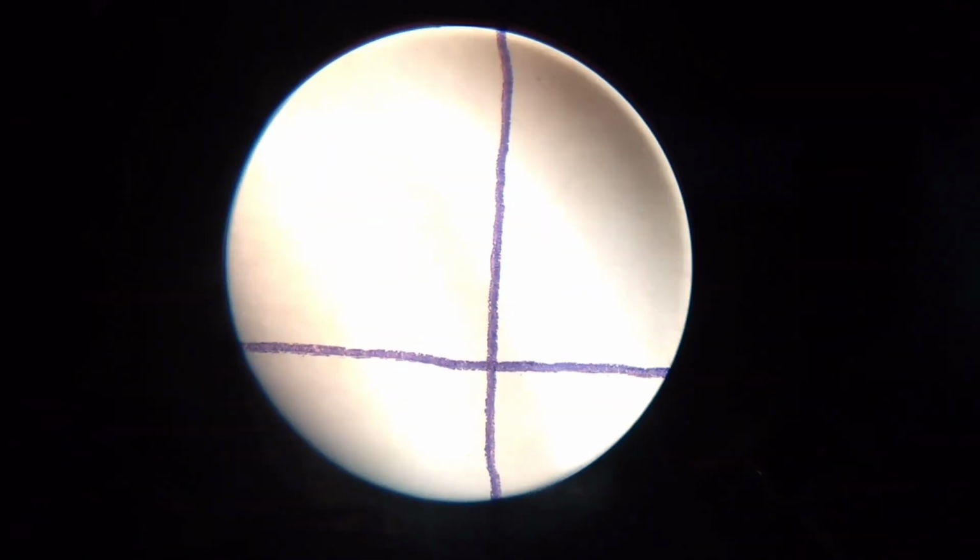Well, as you saw, disassembling and assembling this microscope is quite simple. And then I placed this crosshair, looked at the screen from different angles, tried to catch the double vision, adjusted the rear screw a bit, and in my opinion, the microscope is now fully functional and does not double at all.